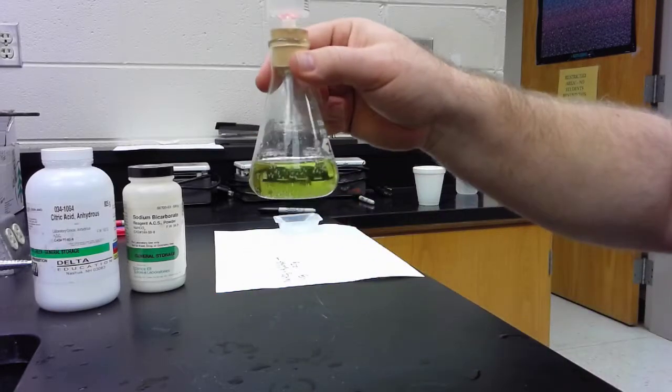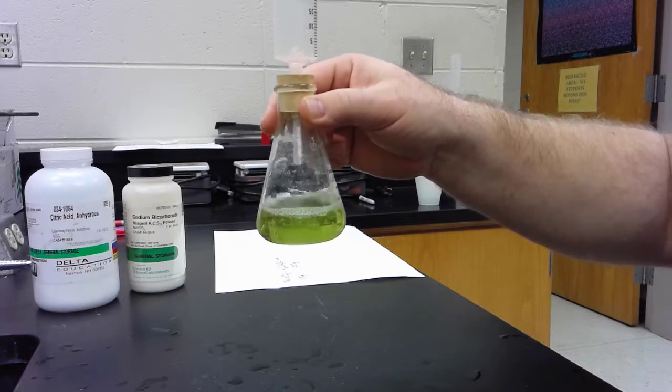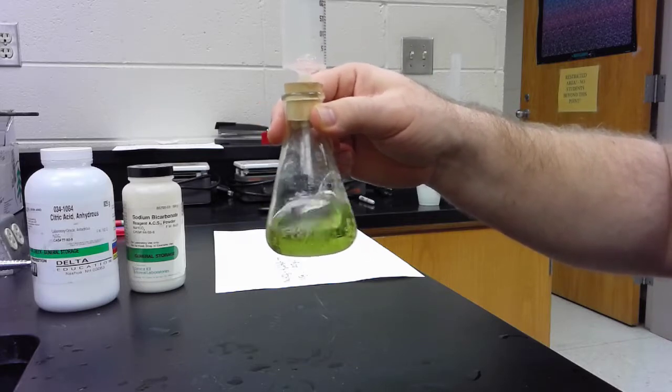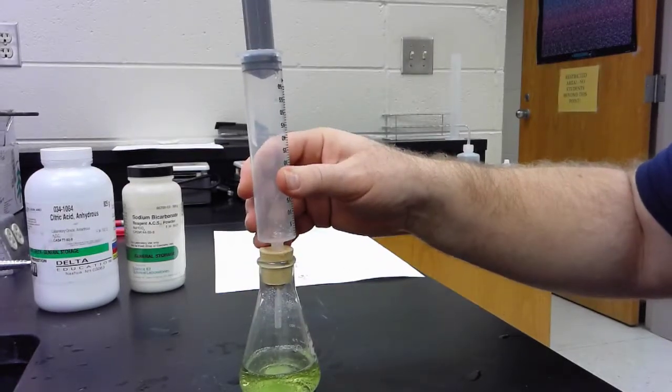The solution has turned fairly green, which is a neutral color for the universal indicator. Green, a little bit yellow green.